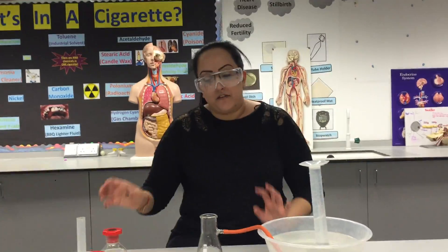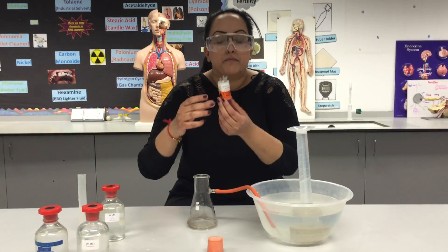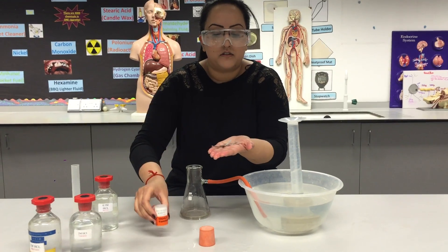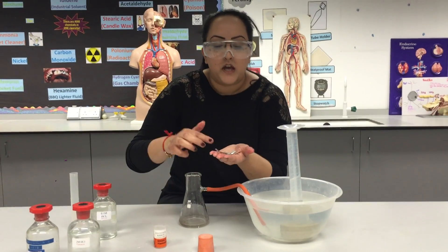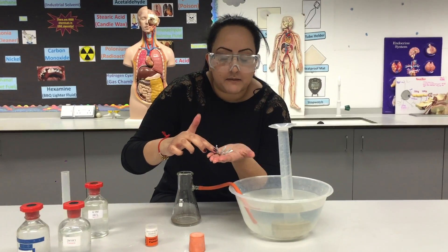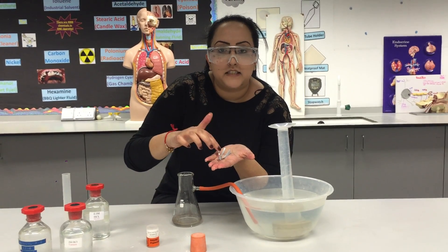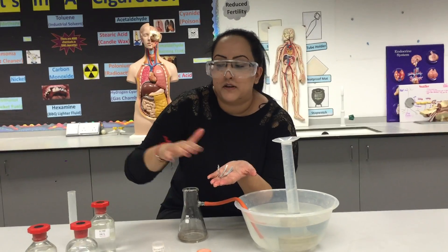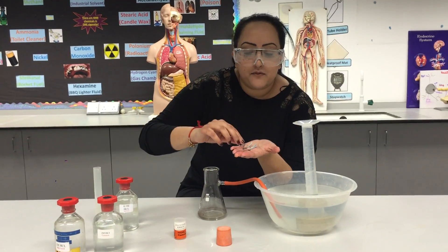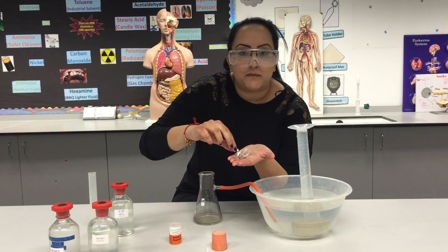This is the really important part. You are going to be given strips of magnesium ribbon — you can hold this, it's not harmful to touch. You need to make sure that your strips of magnesium are all the same length. We are not changing the length of the magnesium in this experiment; we are just changing the concentration of the acid. If one strip is longer than the other, just get some scissors and make sure they are all the same length.